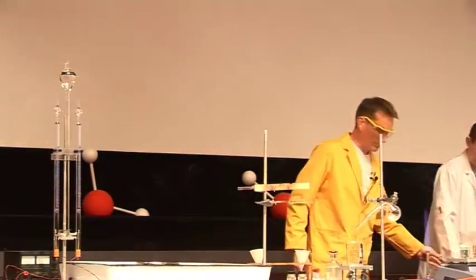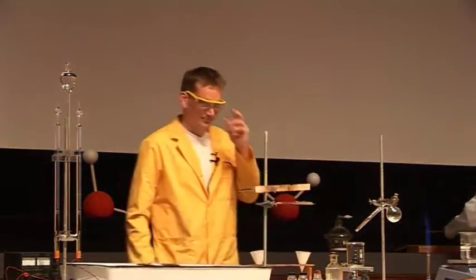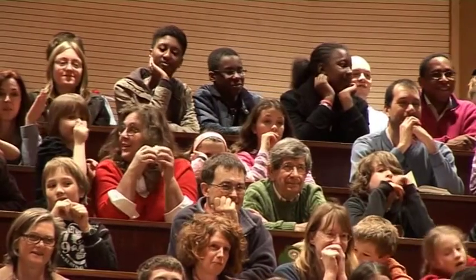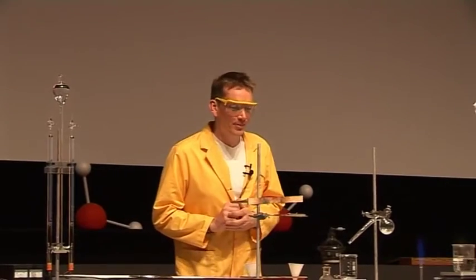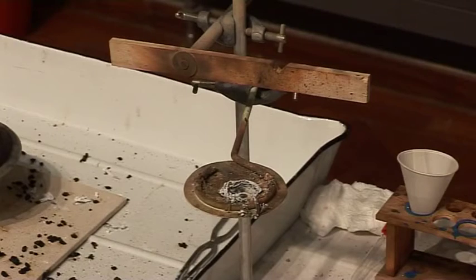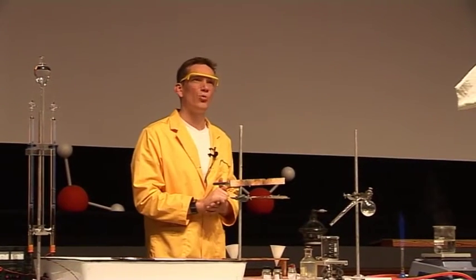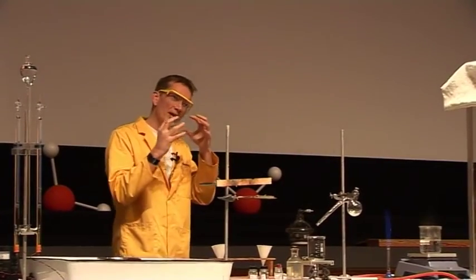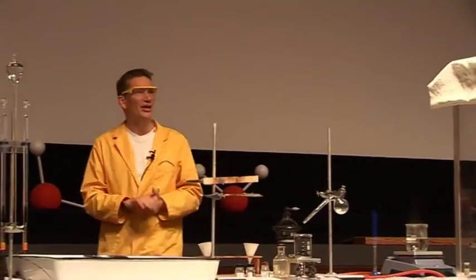The reaction takes place. You may well wonder what happened to the little aluminium dish that this was in — it's completely gone. So a very, very violent reaction, started just by a drop of water. The water allowed the two substances to really mix intimately in order for the reaction to take place.